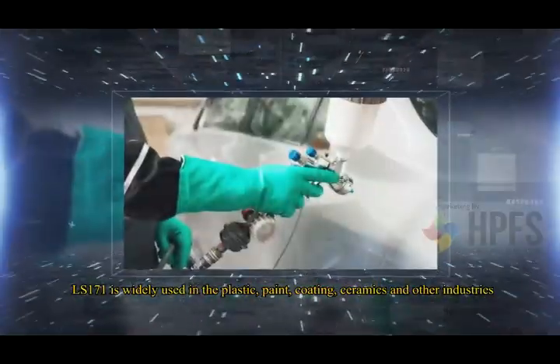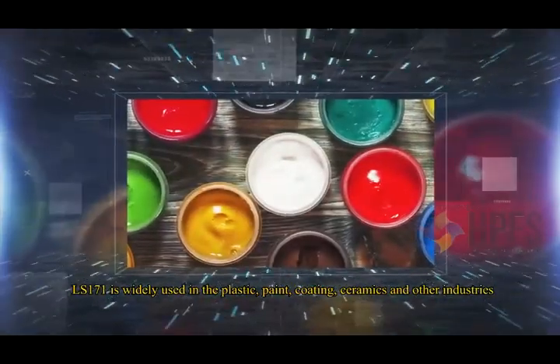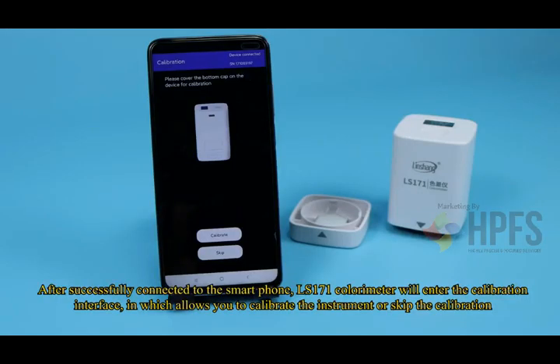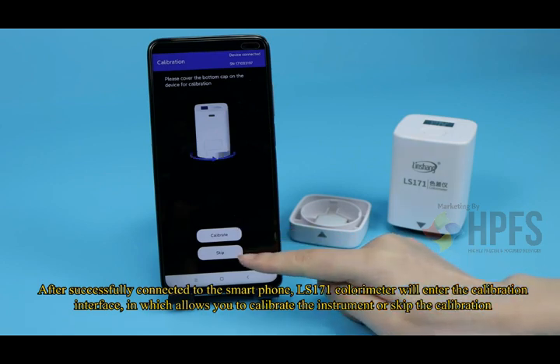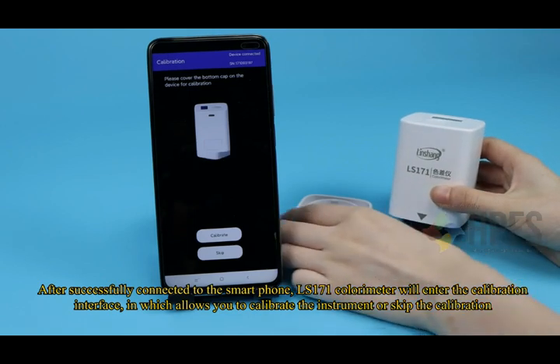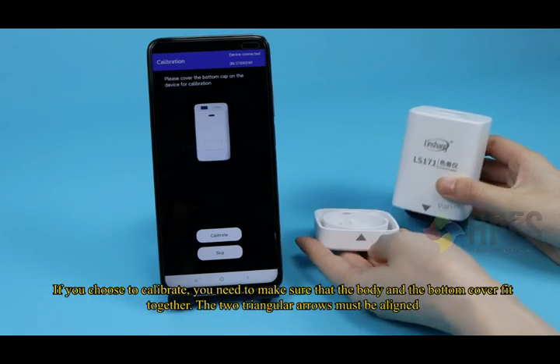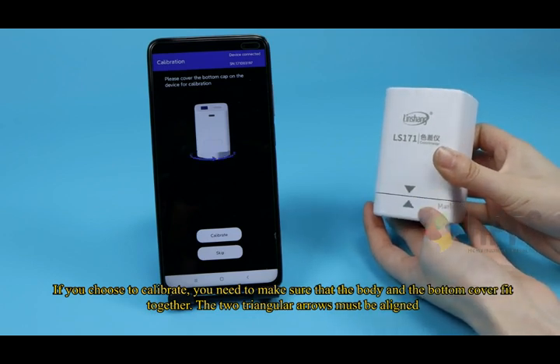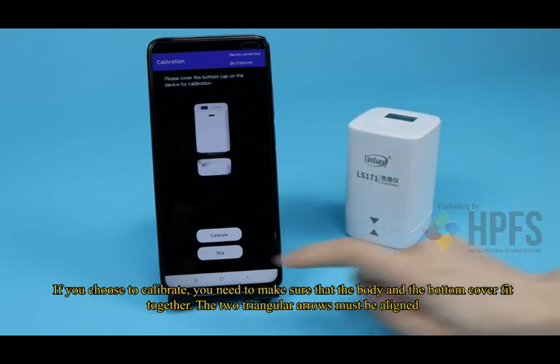LS171 is widely used in the plastic, paint, coating, ceramics and other industries. After successfully connecting to the smartphone, the LS171 Colorimeter will enter the calibration interface, which allows you to calibrate the instrument or skip the calibration. If you choose to calibrate, you need to make sure that the body and the bottom cover fit together. The two triangular arrows must be aligned.